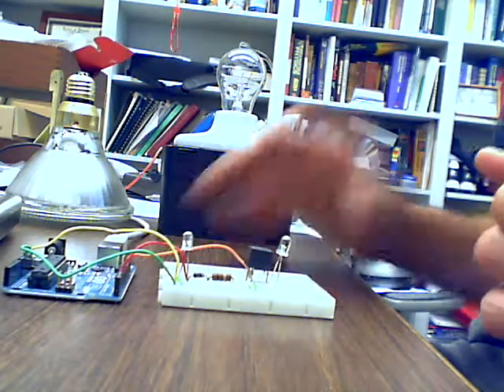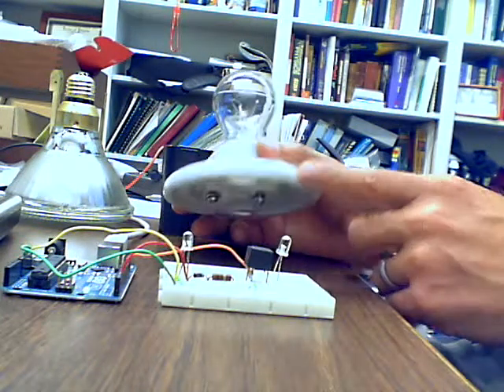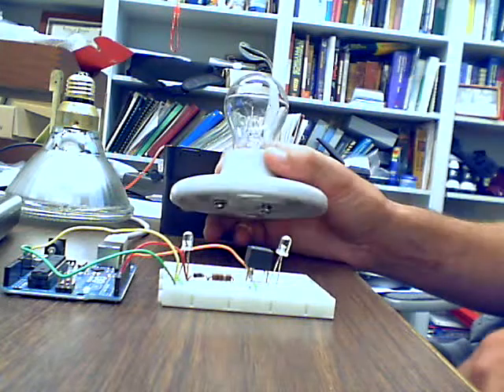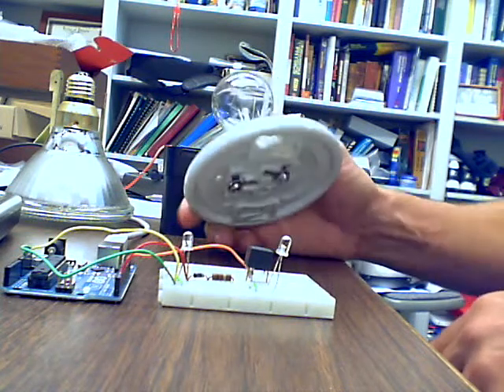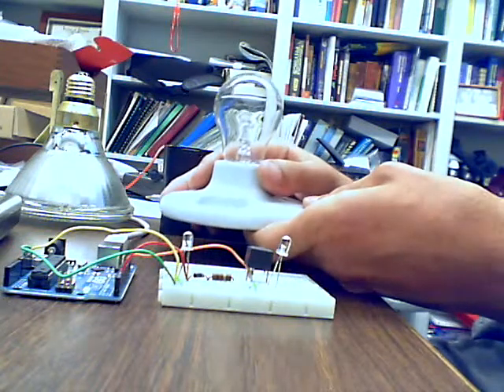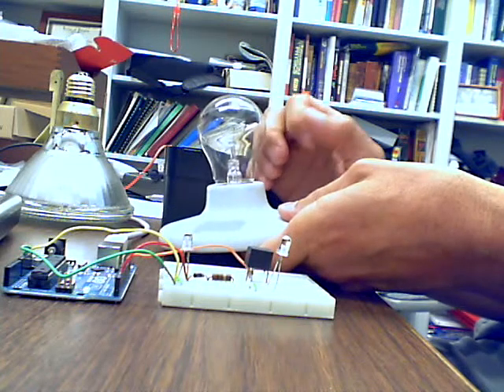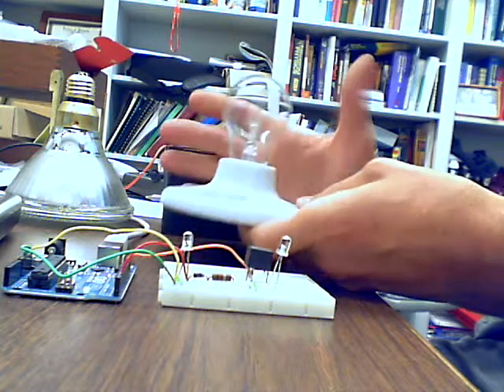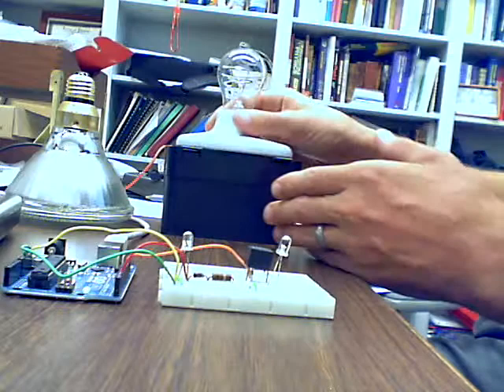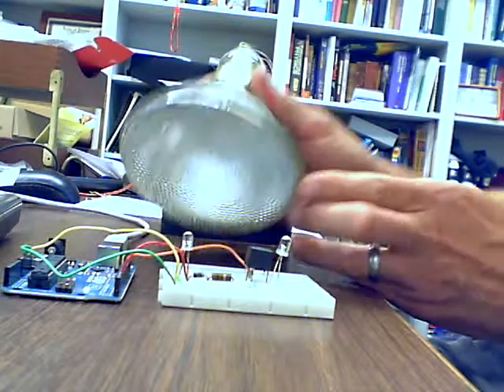Okay, so what I'm going to do is replace the LED with a light bulb that's in a ceramic mount. You can use plastic if you want. I believe that's what we used in the paper that's in the Journal of Undergraduate Neuroscience Education. I'm going to use a regular 40-watt light bulb here, just because it's a little smaller. For the heat lamp, we're actually using a 100-watt halogen light.